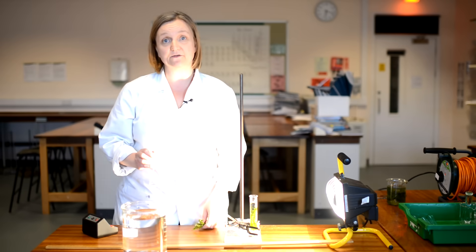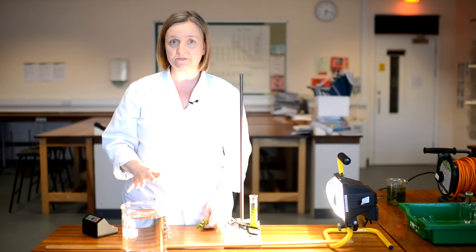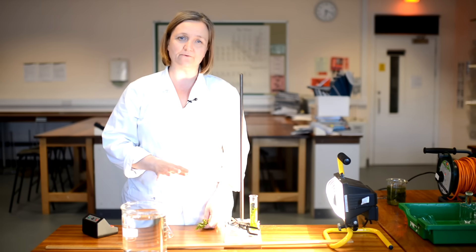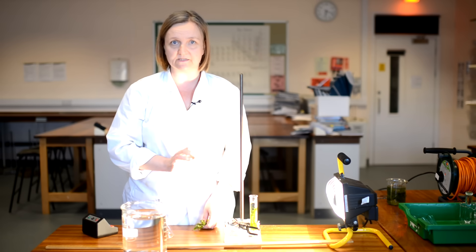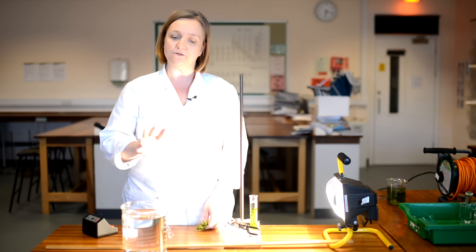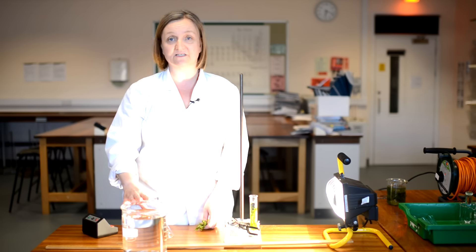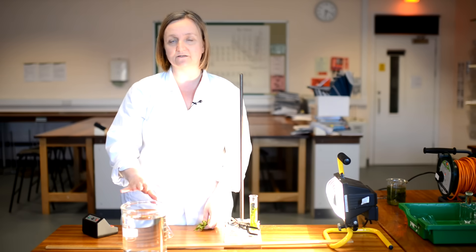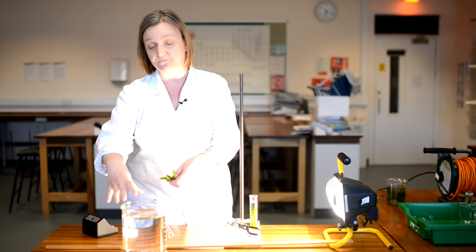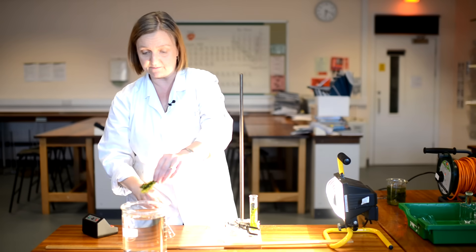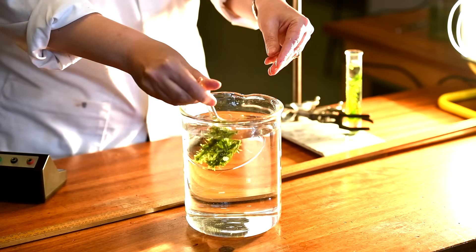There is another way that you may have seen this experiment being done. And this is where we actually collect the gas because, of course, one of the errors that we may have introduced in the first method is that we've assumed that every bubble of oxygen produced is exactly the same volume. So you may see it where we collect the volume of oxygen so we can measure it more accurately. Or you may just collect the oxygen to prove that it is oxygen gas that the pond weed is producing. So this method, I've got a large beaker full of water. I'm going to take some of my pond weed and I'm going to trap it under a glass funnel and place that in the bottom of the beaker.